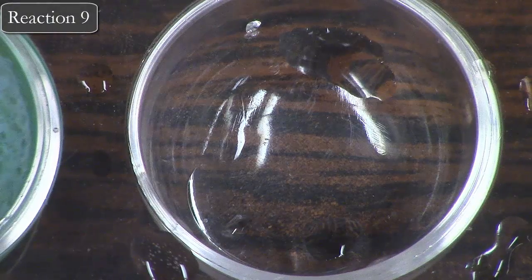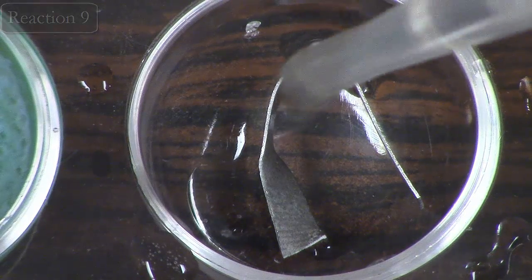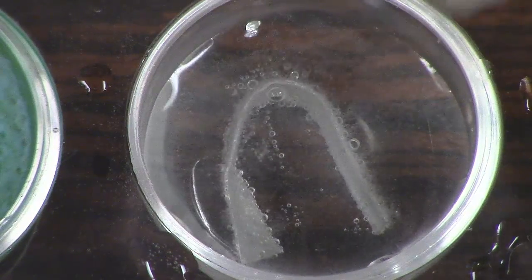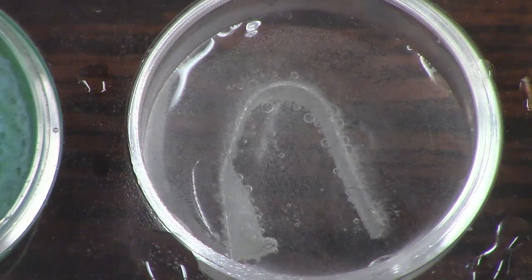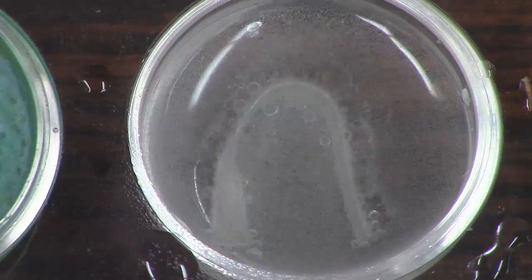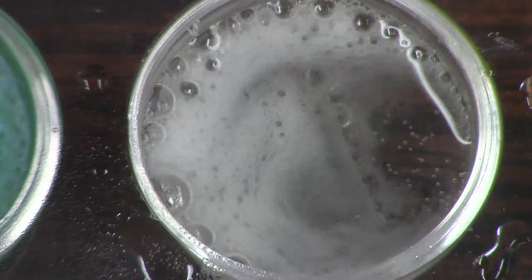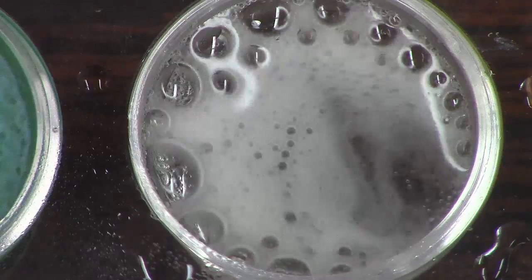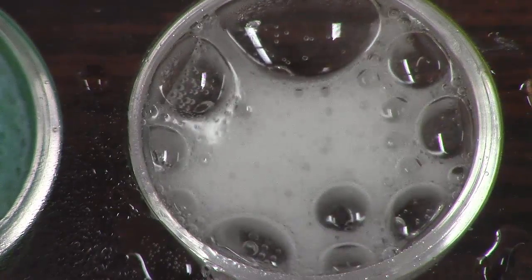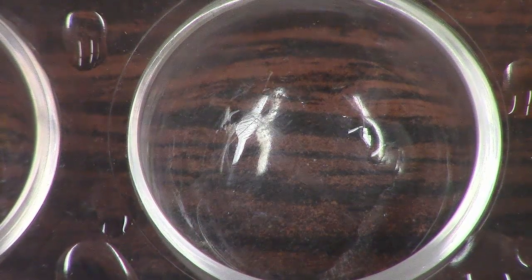We'll keep moving on here. We're going to do magnesium plus nitric acid. Watch carefully and try to predict what gas is forming there. That reaction will also take a bit of time.